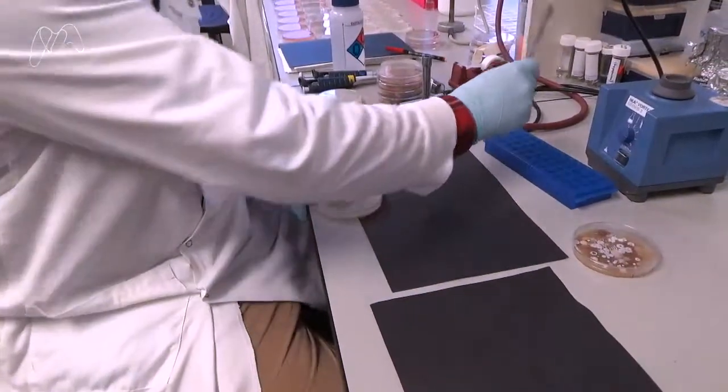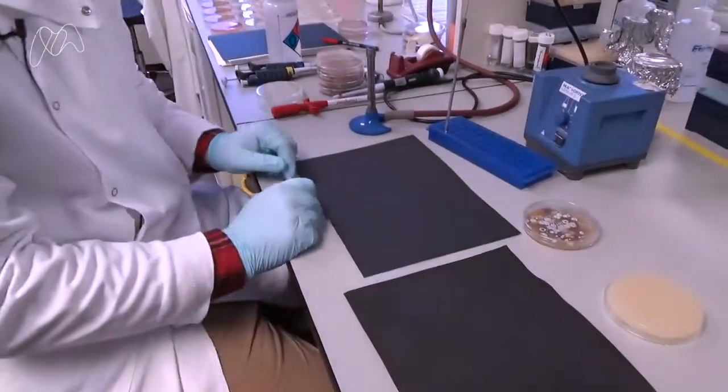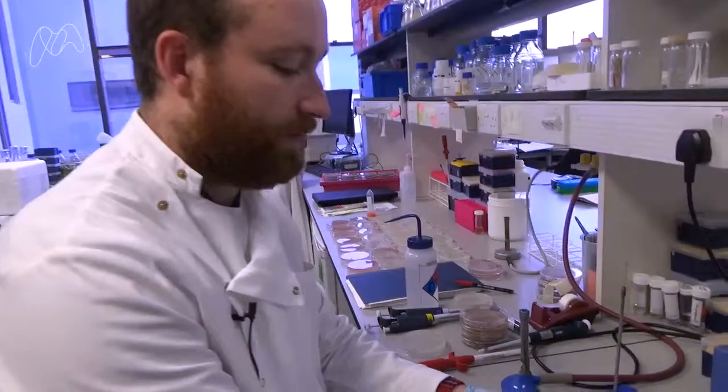So when we've done this it can be grown in the incubator and in the end we end up with something like this.